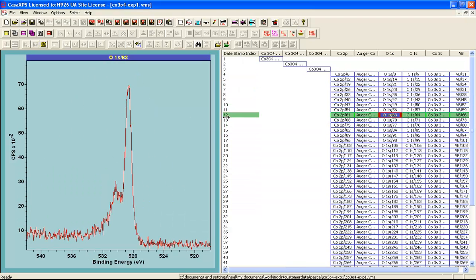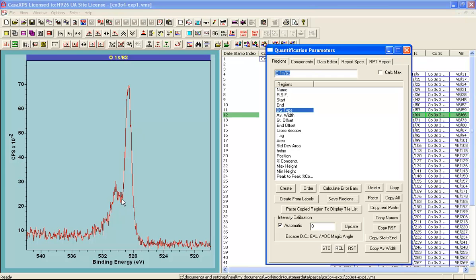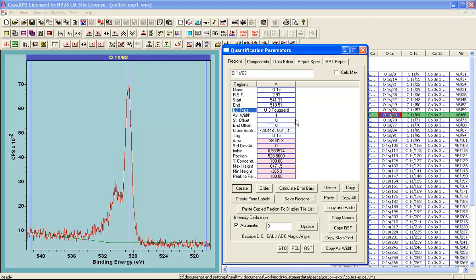So I will now choose one of these spectra and create a rudimentary peak model. I don't really know all of the components that ought to be within this oxygen, but what I can see is a very significant peak structure here, and what I propose to do is to fix the position of this peak within this type of envelope and then propagate that peak model to all of these oxygen 1s spectra so that they can then be used in a calibration operation. Let's create a background.